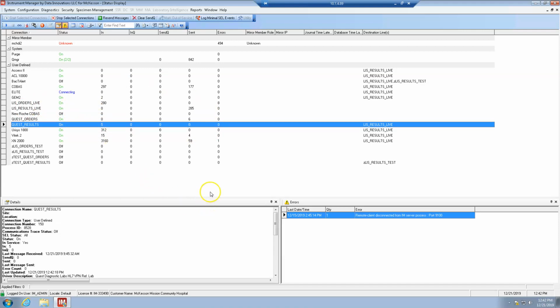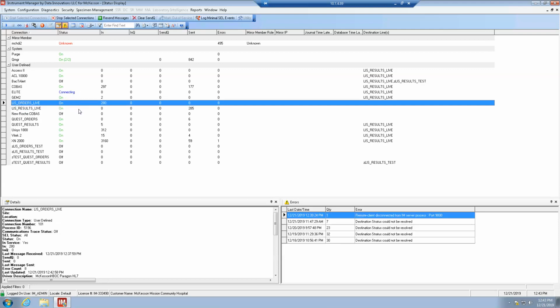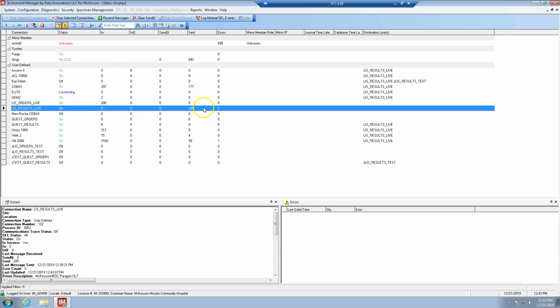Okay. So the next portion is the results that come back. Again, unfortunately, I don't have a diagram for that just yet, but basically it's the same process in reverse. Okay, so this LIS results live is what sends back to Paragon. So if this says connecting or off, that's probably where your issue is. So if the lab calls and says none of the results are processing, the results aren't interfacing, or if they say nothing's interfacing, you're going to check both of these. If they say it's just the results, check this interface.